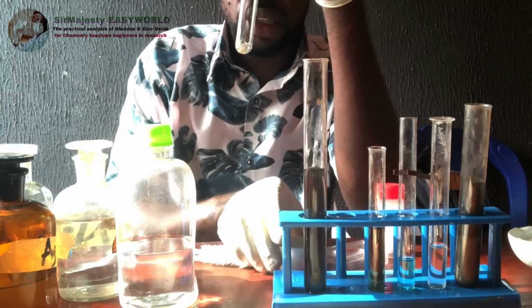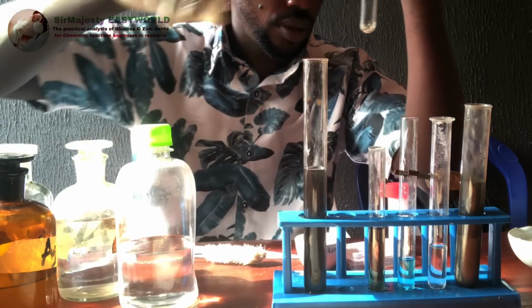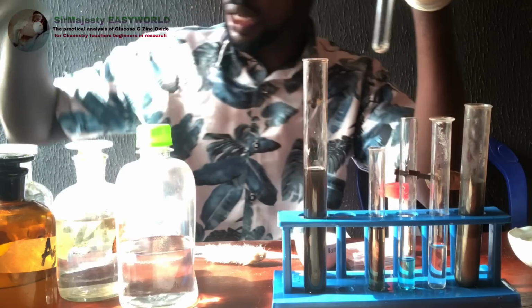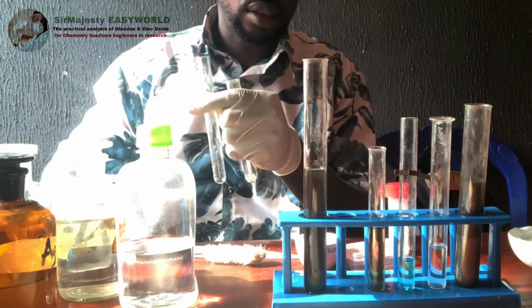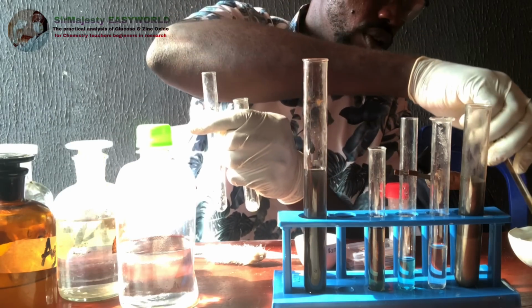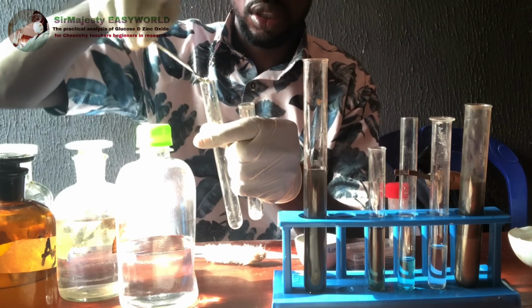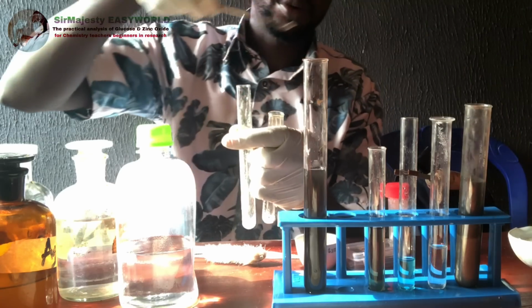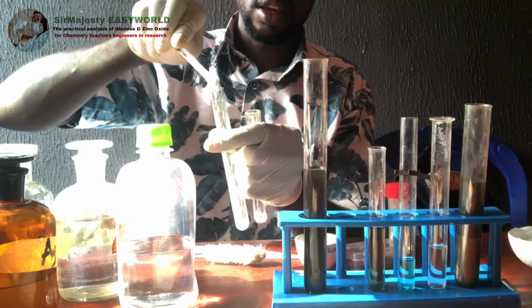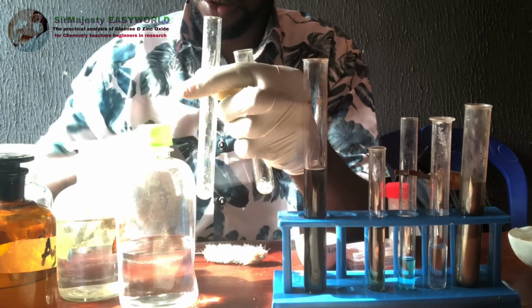So here is the zinc oxide, and over here, okay, let me get a sample of another powder. That over here is not the pure zinc oxide. It should be the zinc carbonate. But if you heat both of them, they turn yellow on heating and then on cooling turn white.